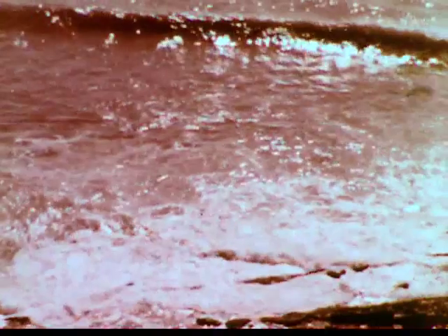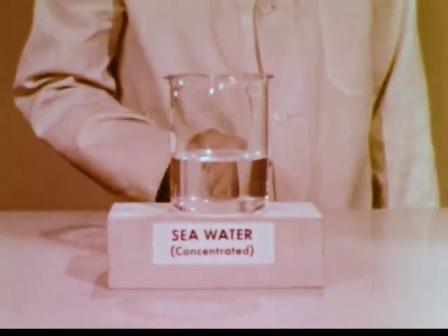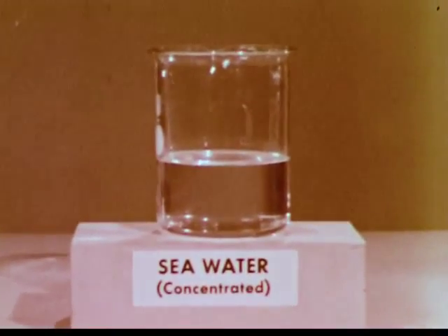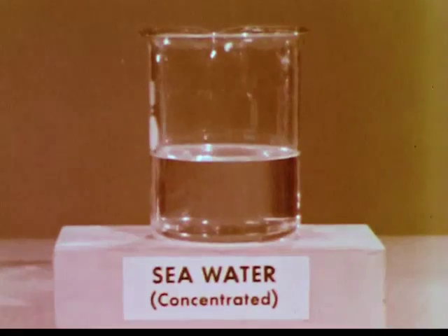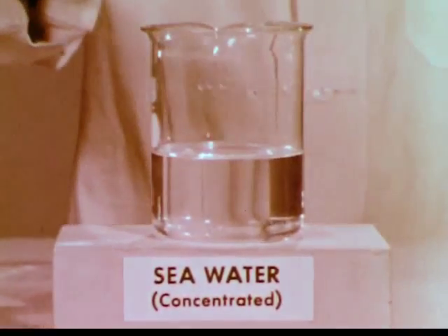When seawater is first concentrated by a factor of about 50, it will make color changes more visible. The absence of any brown color indicates that no great amount of elemental bromine is present. When we check the acidity, the litmus turns blue.